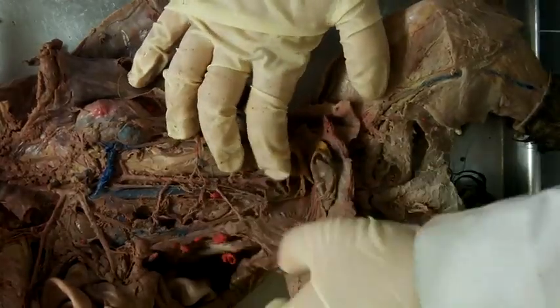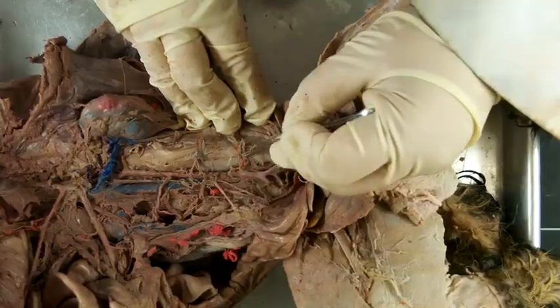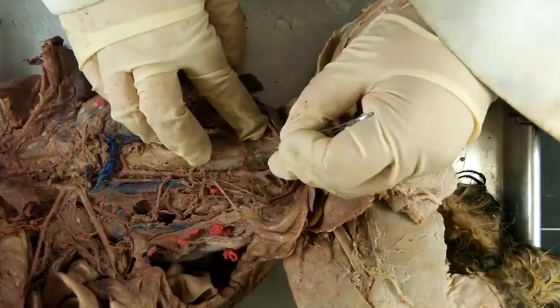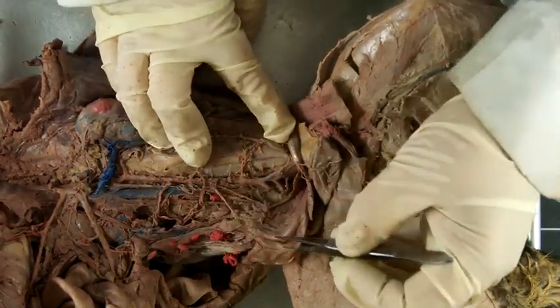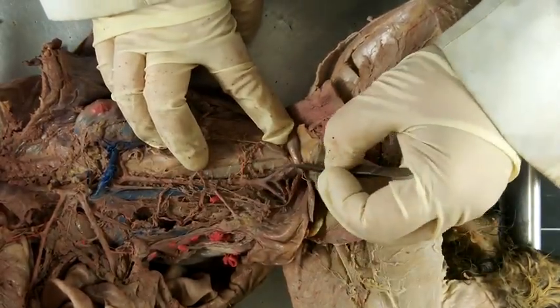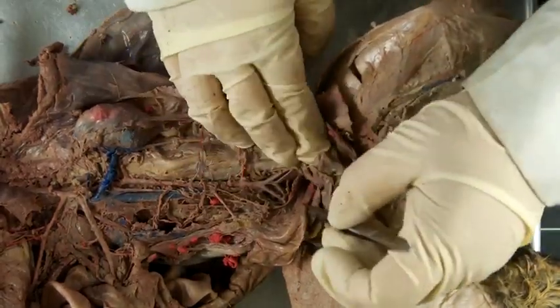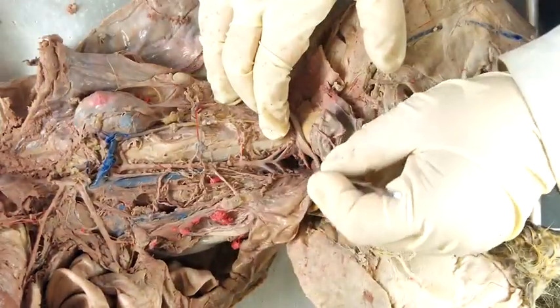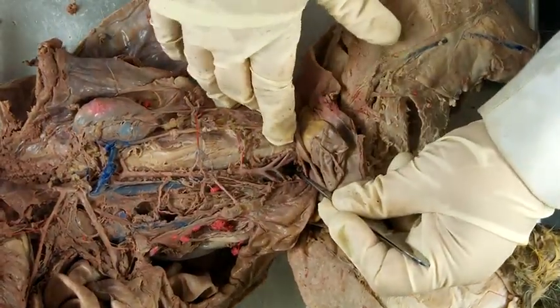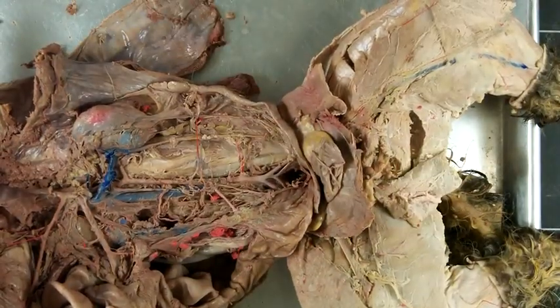As you start to remove connective tissue layers, again, you'll start to see with some clarity things like the deep circumflex iliac artery. There's usually a vein paired with this. It doesn't seem to be present. External iliacs, internal iliacs, and then the deepest portion here, which is difficult to see, is the sacral artery and vein. The sacral artery and vein is going to pass through. Once it leaves the body cavity, it'll be the caudal artery and vein as well.